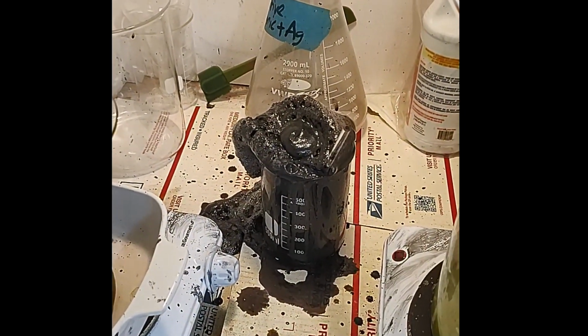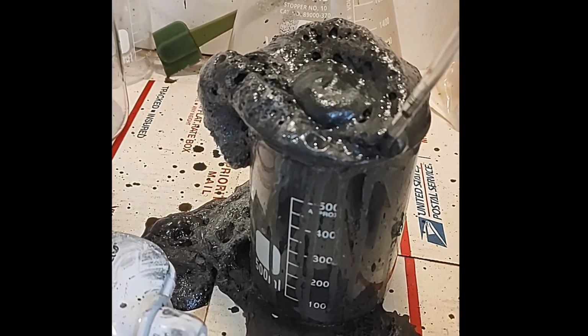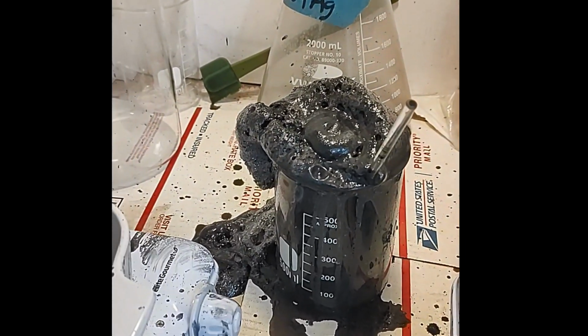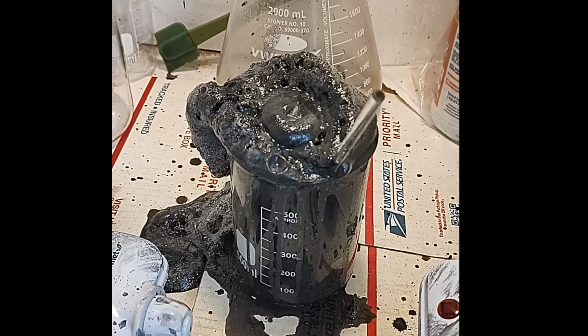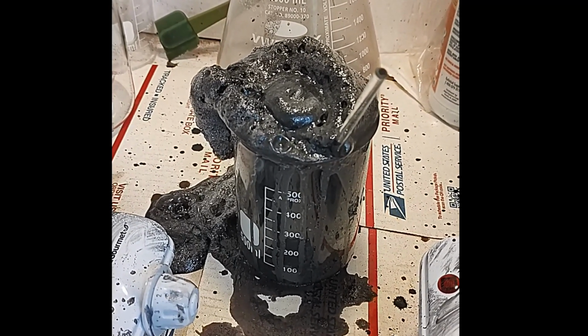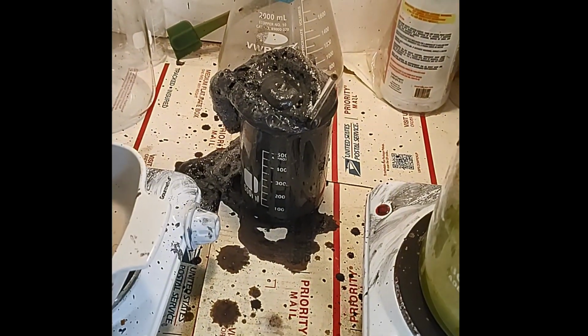Well, that didn't quite work out the way I planned. Oh my goodness, what a mess. I'm gonna have to clean up everything inside the fume hood. Oh my goodness, but I gotta wait for this reaction to stop. Holy cow. What a blooper.